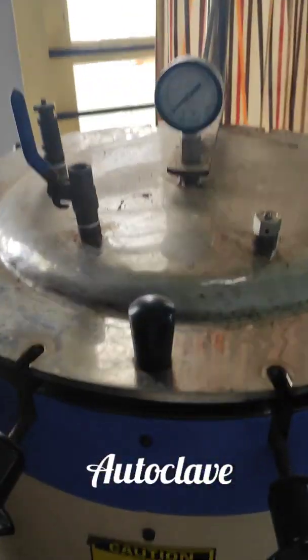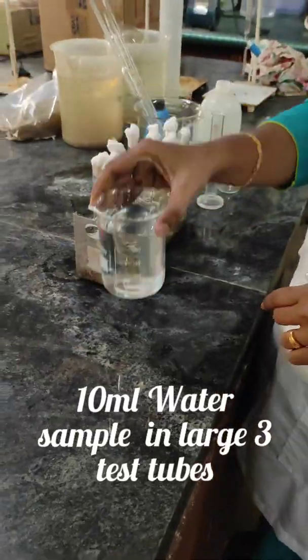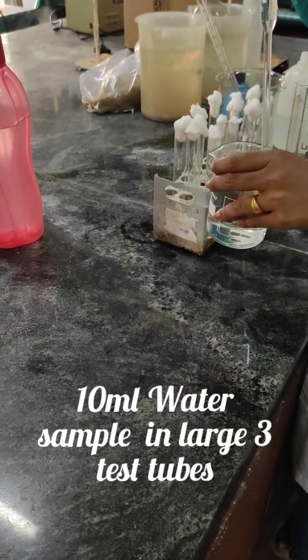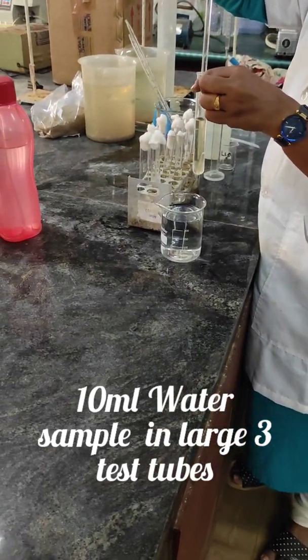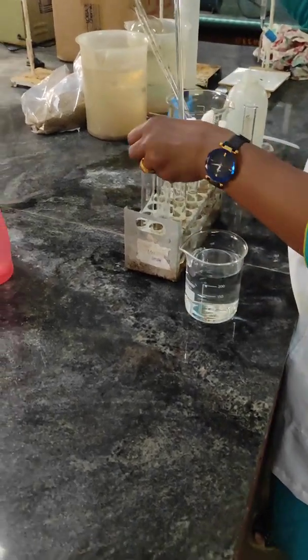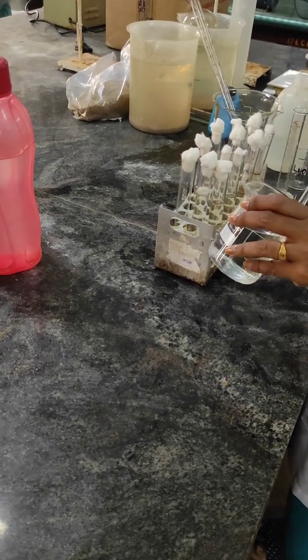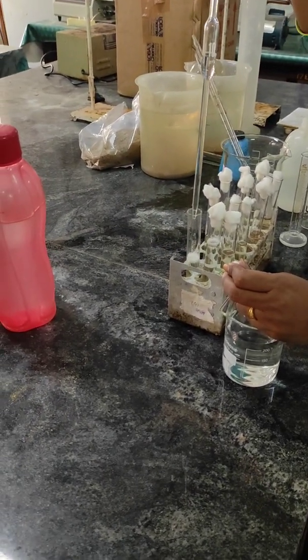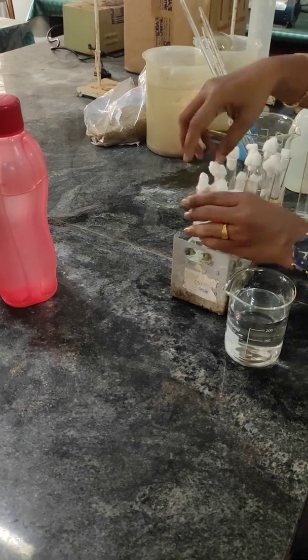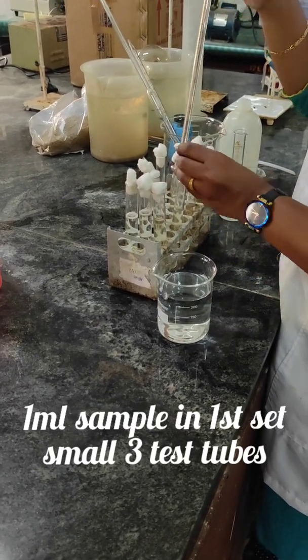Then sterilize all the apparatus and solutions. After autoclave, pipette 10 ml of the given water sample into the large test tubes. Then add the Durham tubes. Put 1 ml of water sample into the first set of small test tubes.